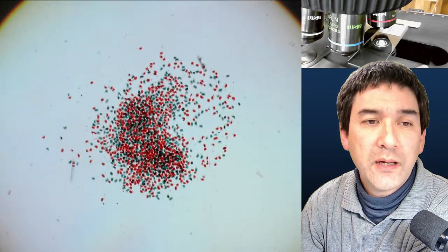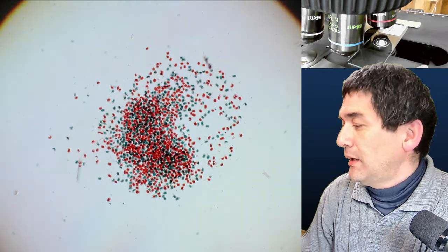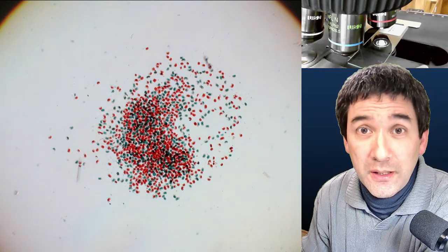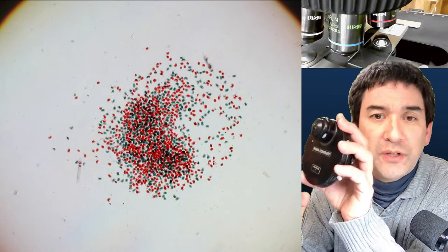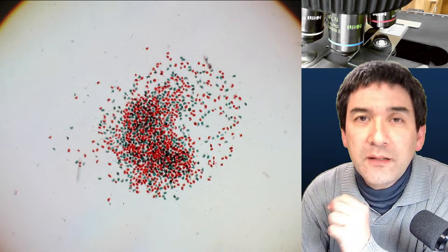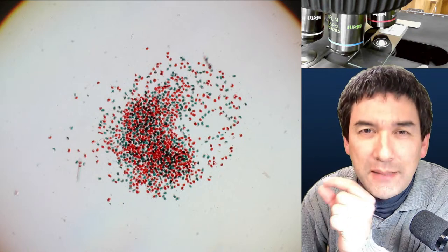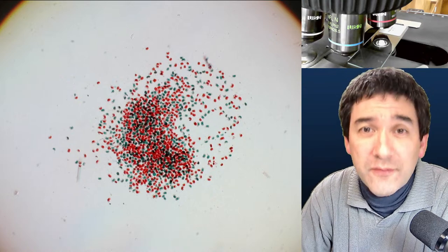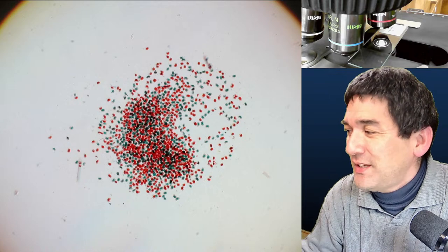We'll start with a commercial slide — a pine pollen whole mount, which is a stained slide. This partly answers the question about whether phase contrast works with stained specimens. I'm using the 4x objective first just to line everything up. You can use phase contrast objectives for regular bright field by simply switching the condenser back to bright field. The phase ring does degrade image quality a tiny bit, but not much.